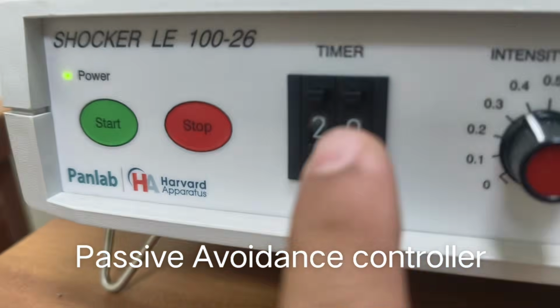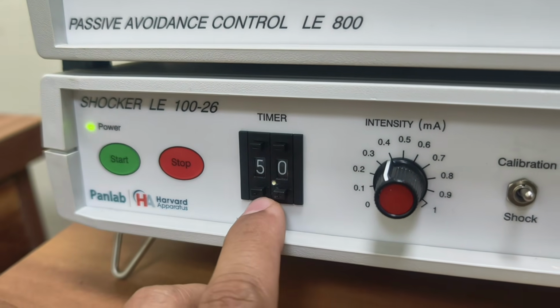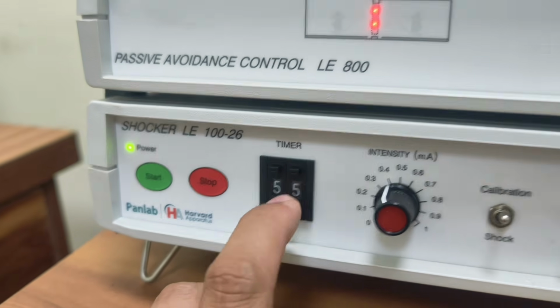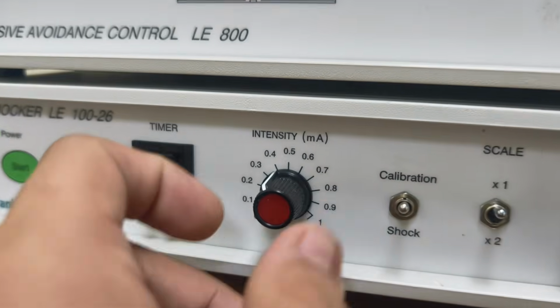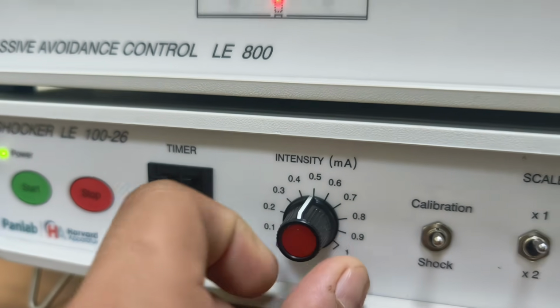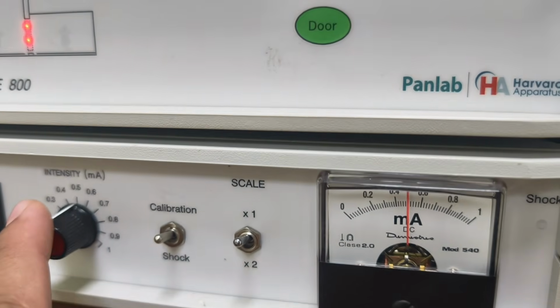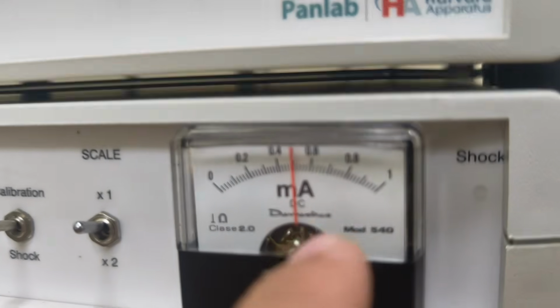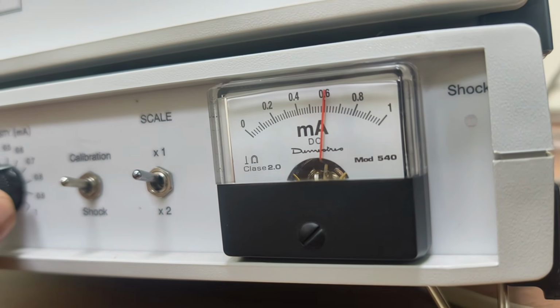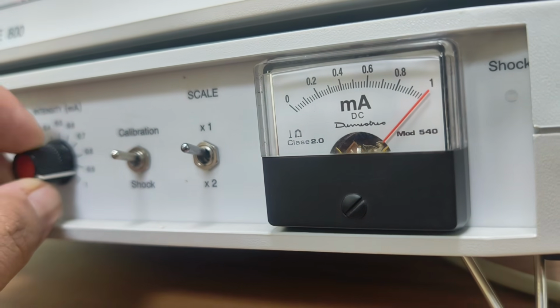Now this is the timer. We can change it to 3 seconds, 4 seconds, 5 seconds. Okay, this is the intensity. It is generally kept between 0.2 to 0.5 milliampere. This is set on calibration. Once this is on calibration, we can see now this is 0.5. I will change this to 0.6. So this is now changed to 0.6. This is now changed to 1.